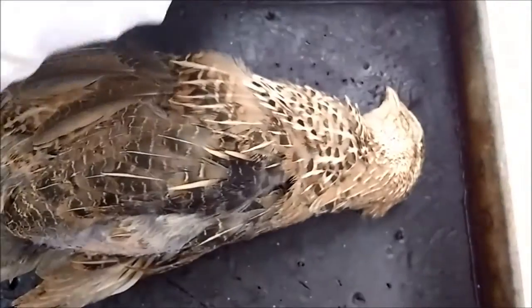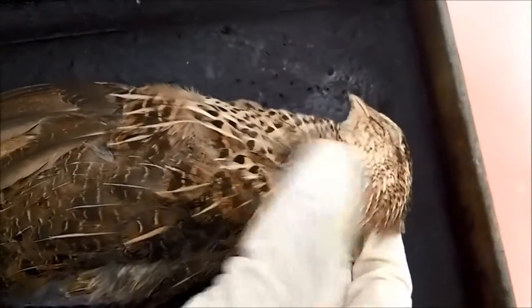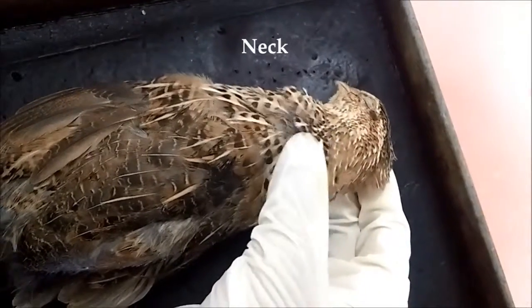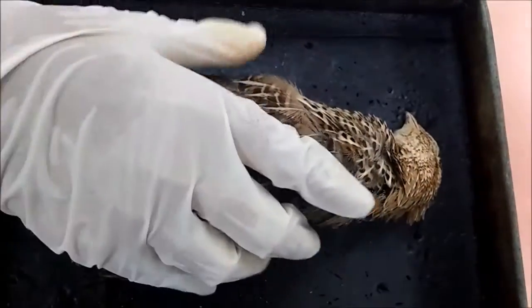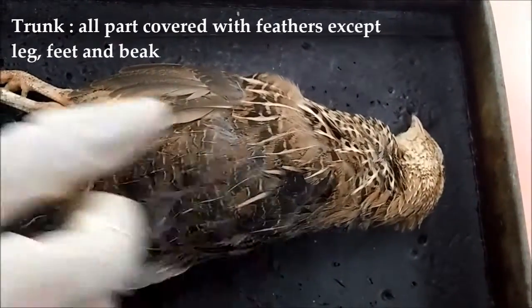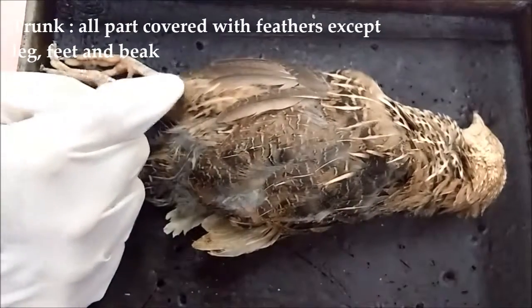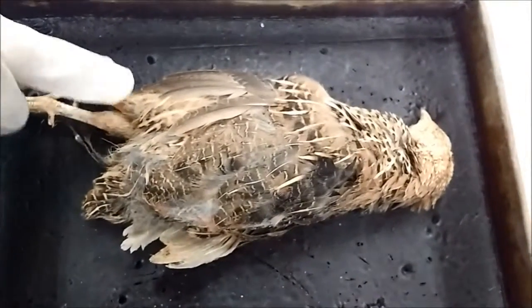Then we go to the second part of the body, which is the neck. The neck is long and mobile. We can see here the neck is from here to here. Then for the body part, the trunk, all parts of the body are covered with feathers, except for the shank of the legs and the feet, which have scales similar to those in reptiles, and the beak. So we can see that the legs have scales, and the beak also has some scales.